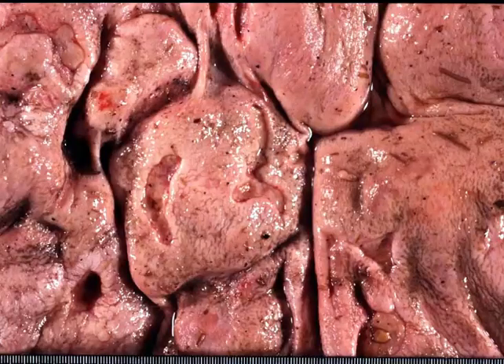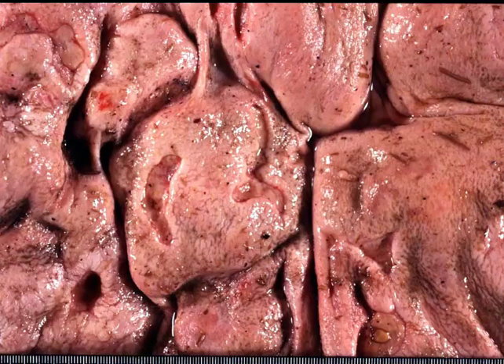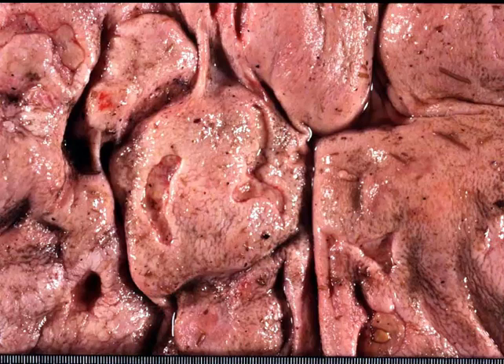Slide number three is from an ox. How about a morphologic diagnosis and a clinical sign? Okay, time's up.